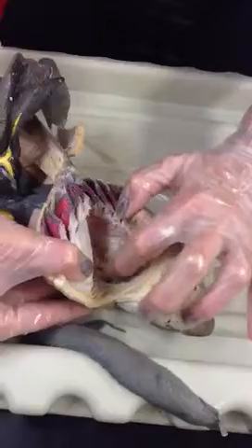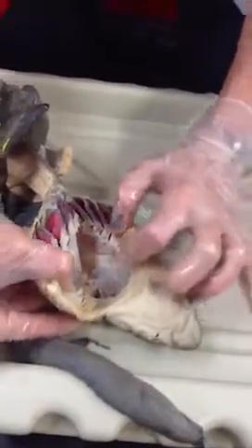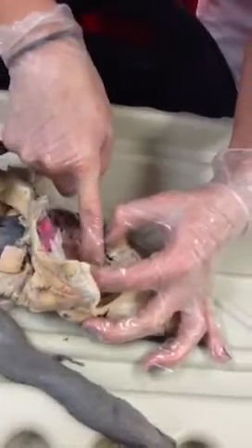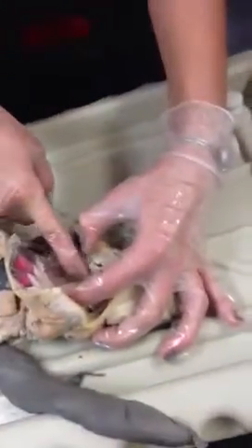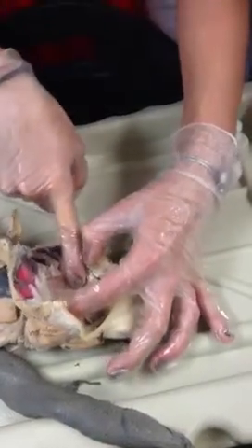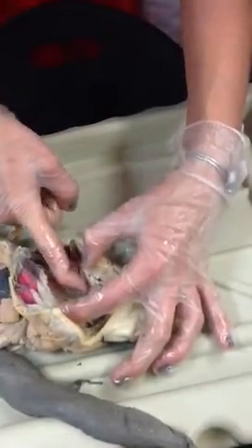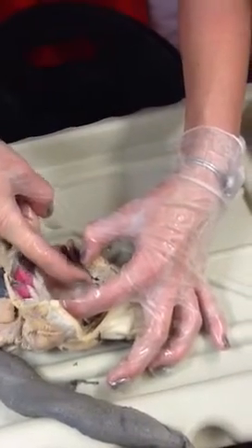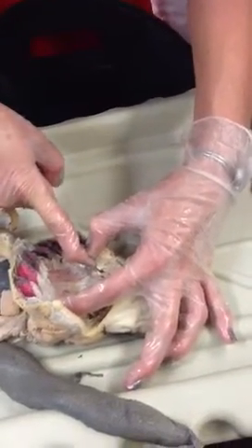And then inside the mouth here, the top part that we have is our internal carotid. Coming from the middle here, you should have your vertebrals, but we can't see it in this shark. However, you can see my radix aorta very slightly. The radix aorta is going to come up and arch to connect with your internal carotids and then extend out into your hyoid and epibranchial.